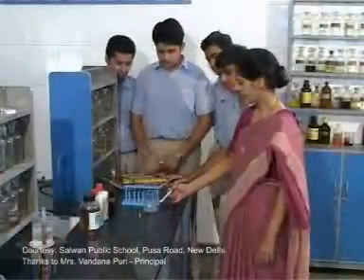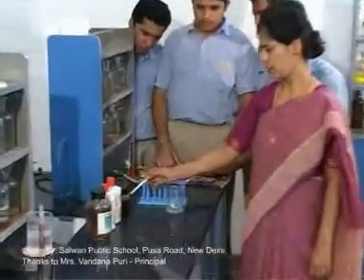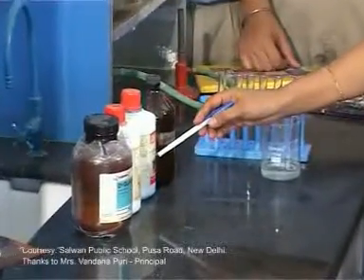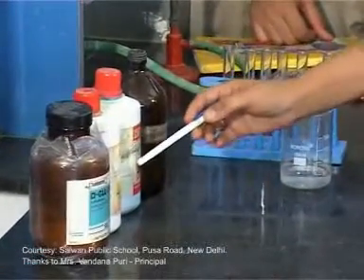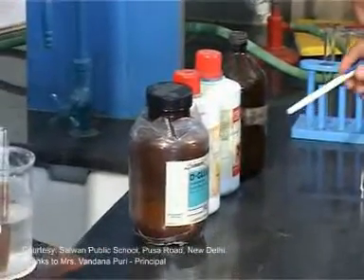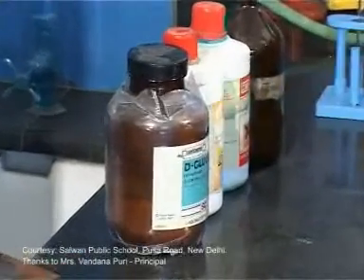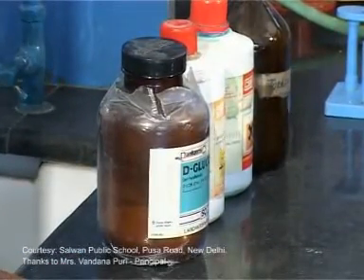Here is the glucose solution, this is Tollens' reagent, this is Fehling's solution number one, Fehling's solution number two, and this is the glucose whose solution has already been prepared.